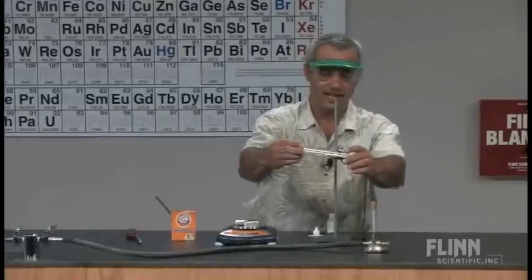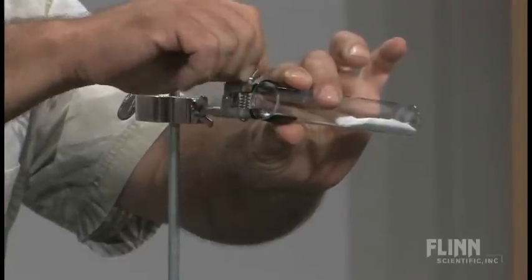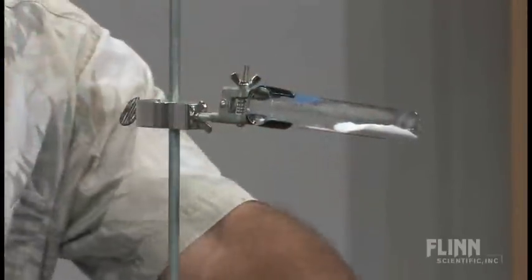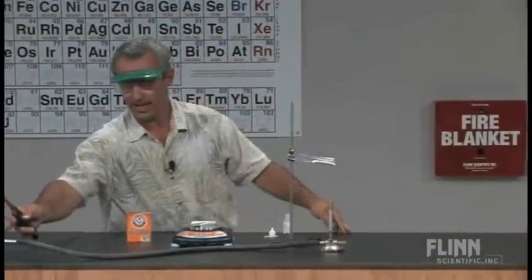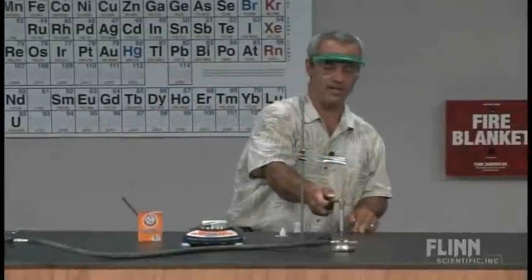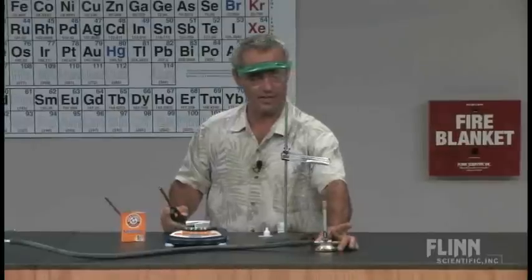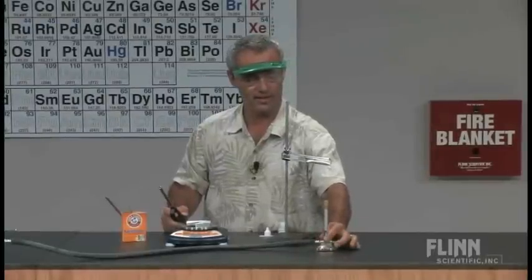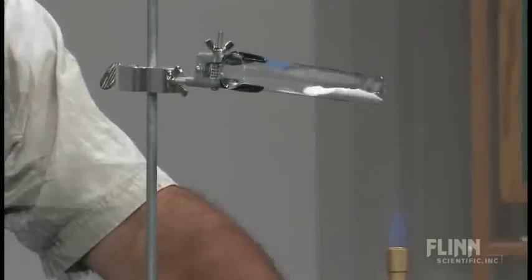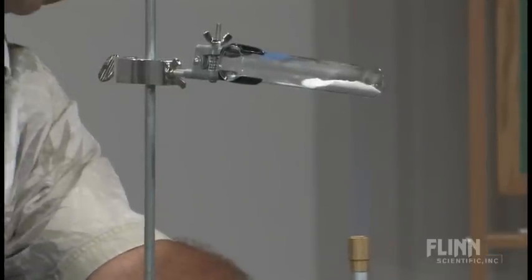Now they set it up in a ring stand like this, making sure to clamp it way up here near the top so they can heat the entire sample. And for this you really need a cool flame. It doesn't take much to decompose sodium bicarbonate. So I don't know if you can even see that flame, but it's a cool flame. This hot flame works, but I like the cool flame better and I'll tell you why.